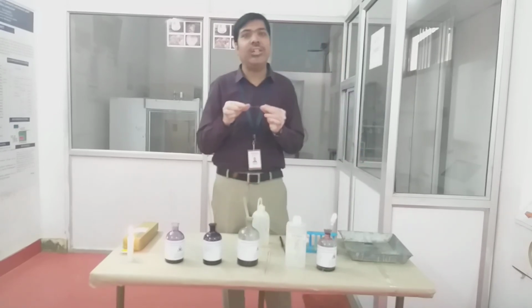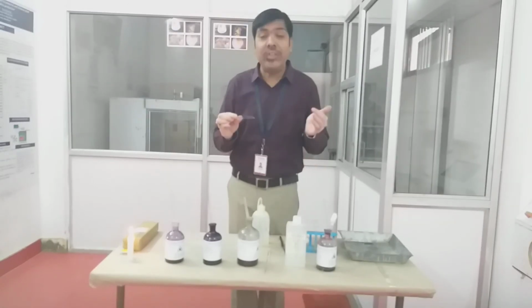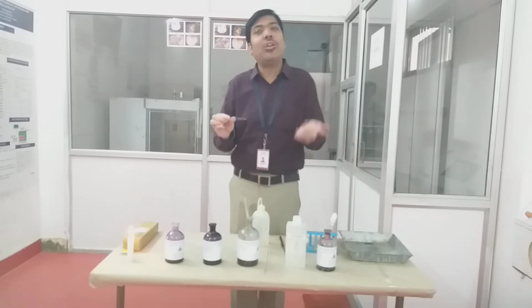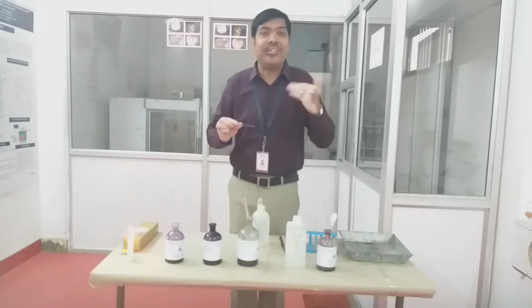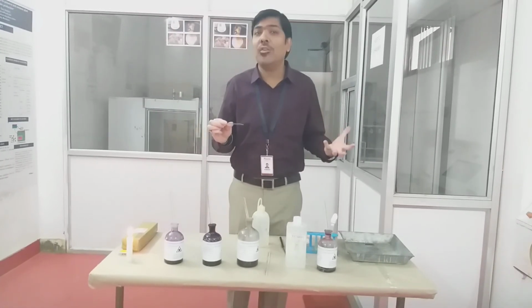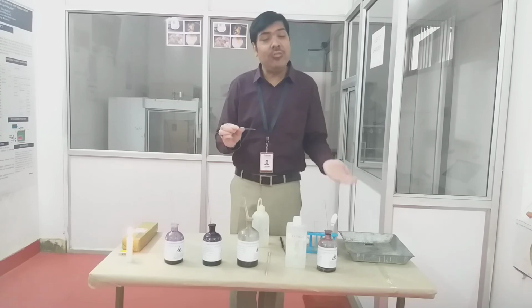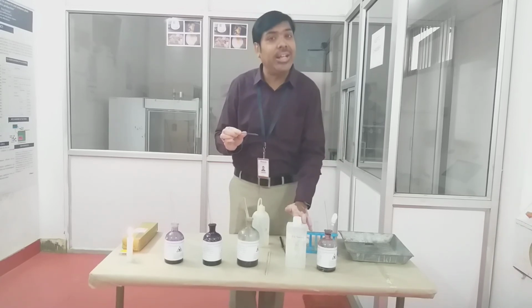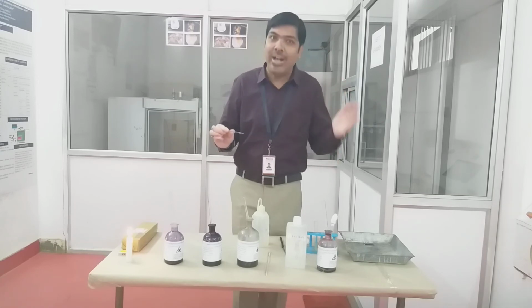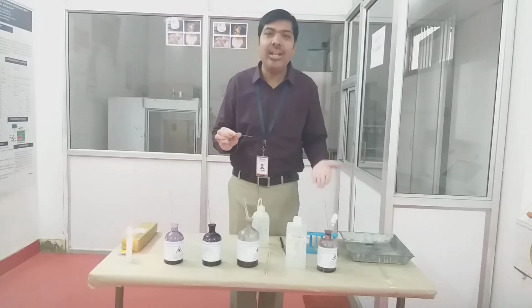Then we go for the addition of the safranin, and again we wait for some time. Why are we adding safranin here? Because the gram negative cells have now become colorless. If you want to differentiate the gram positive cell from the gram negative cell, the safranin dye will stain the decolorized gram negative cells. The gram positive cells are already stained because of the CVI complex, appearing violet or blackish violet, but after the application of the decolorizing agent, the gram negative cells are colorless. So to visualize and differentiate them, we need to counter stain the slide with a counter stain like safranin.